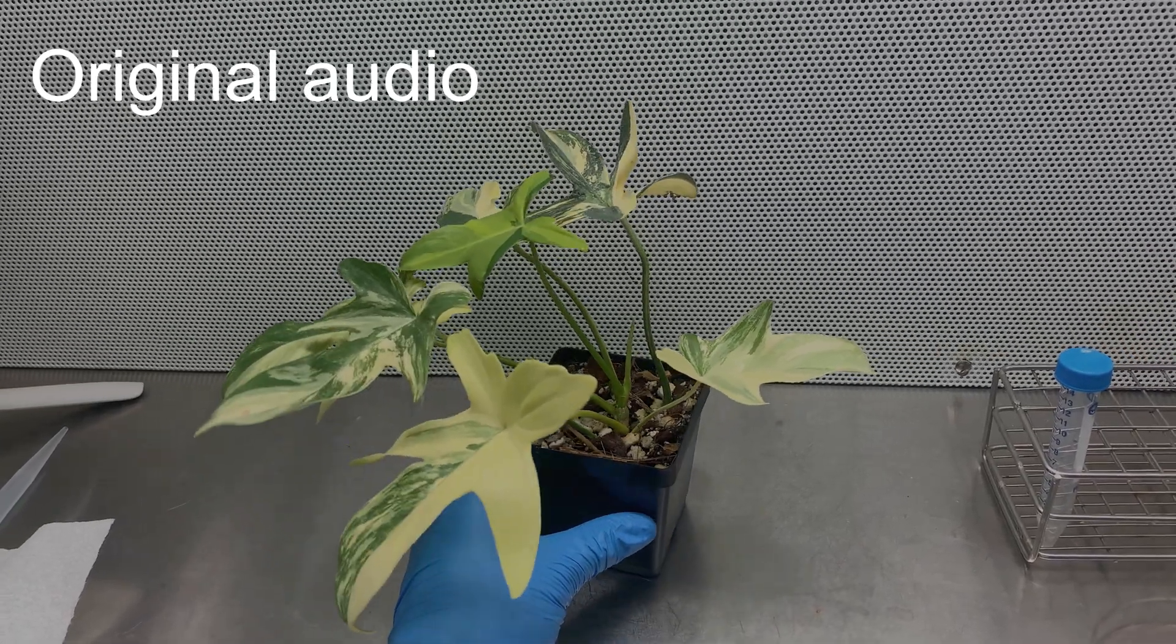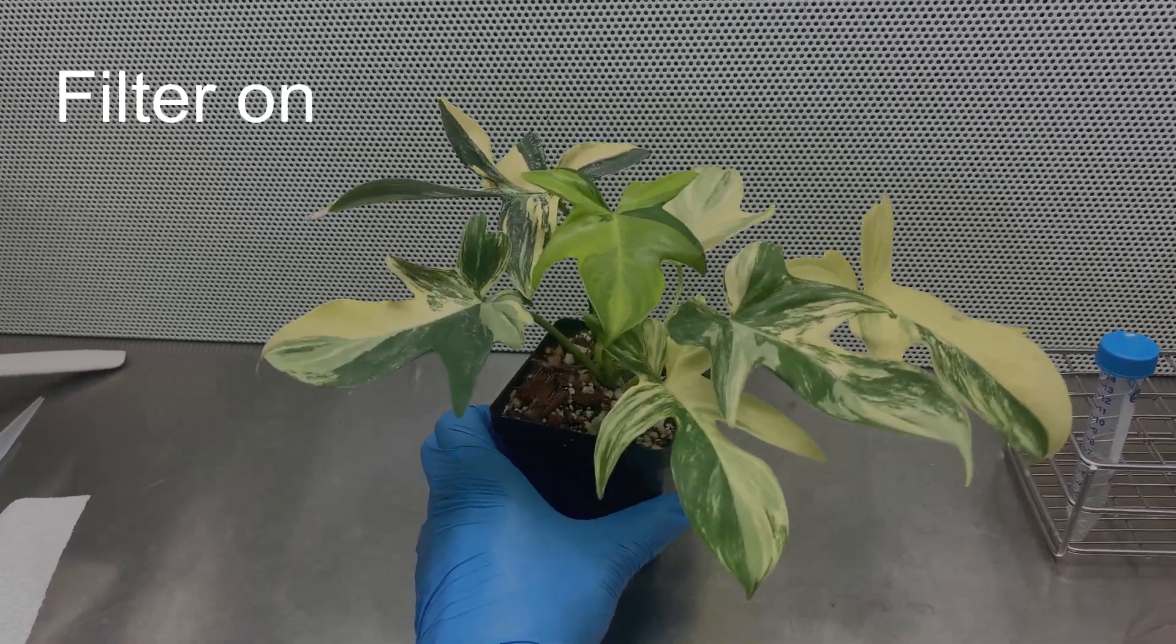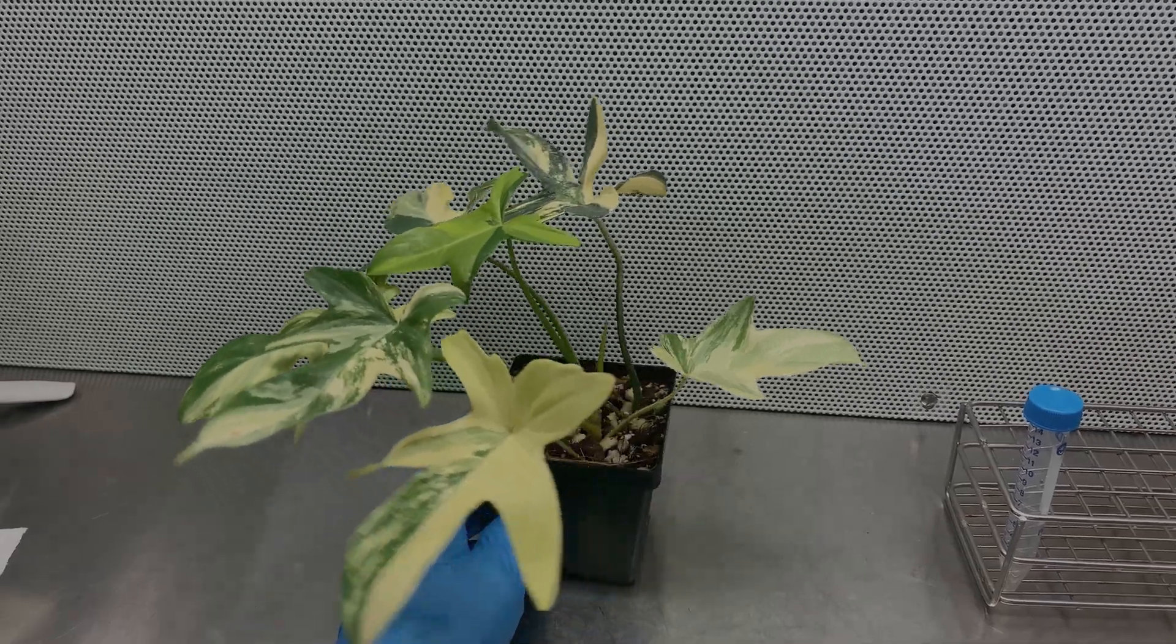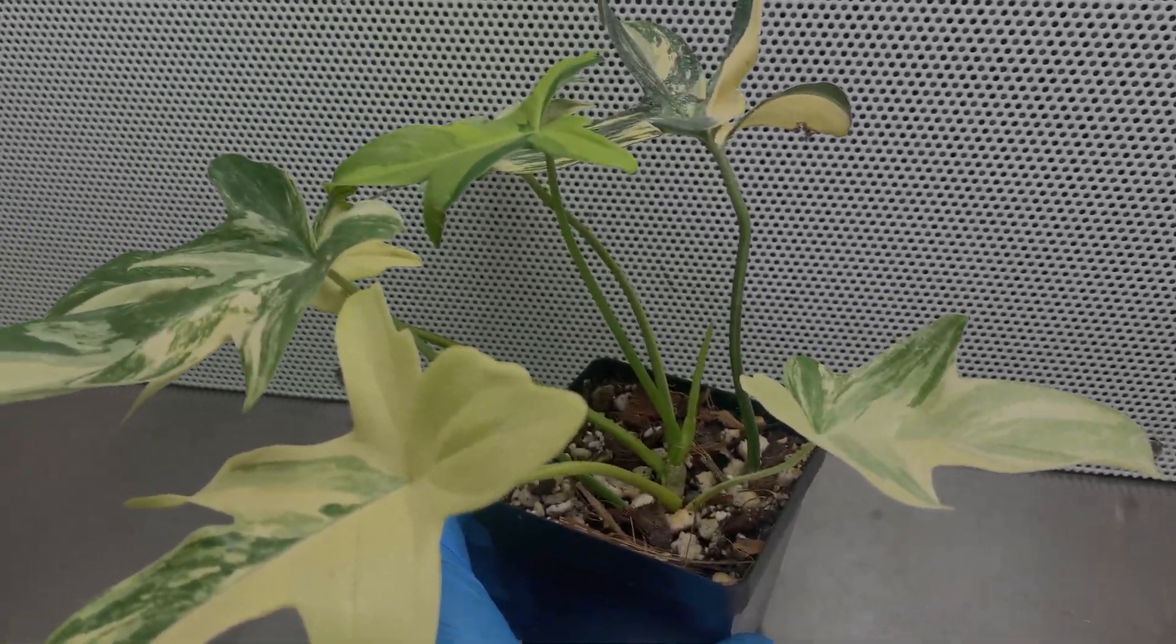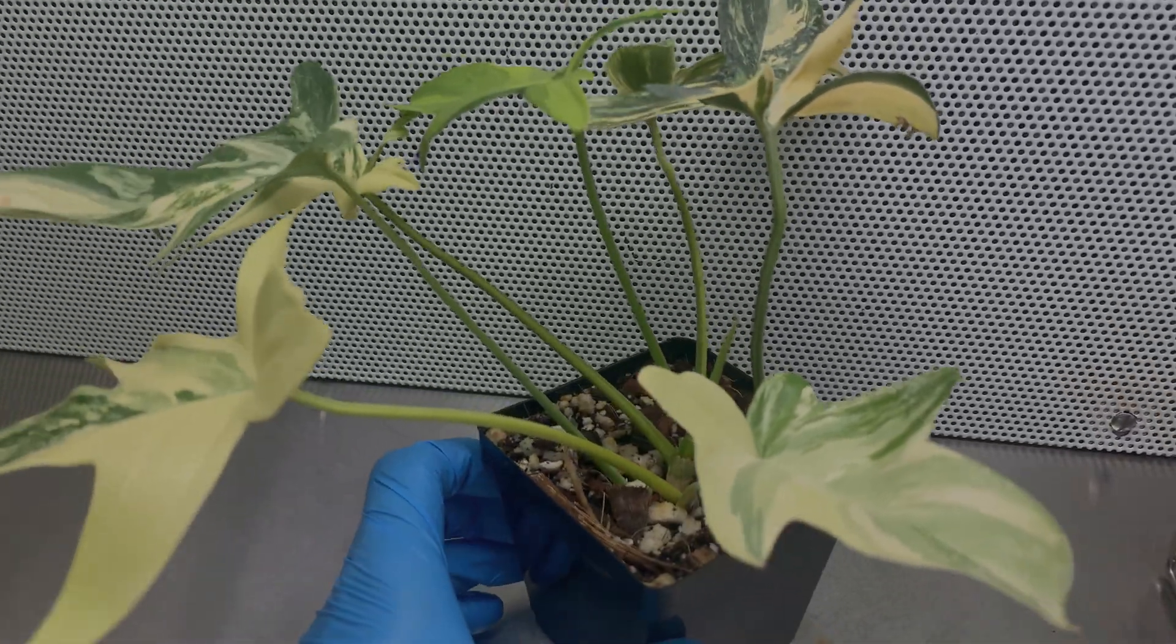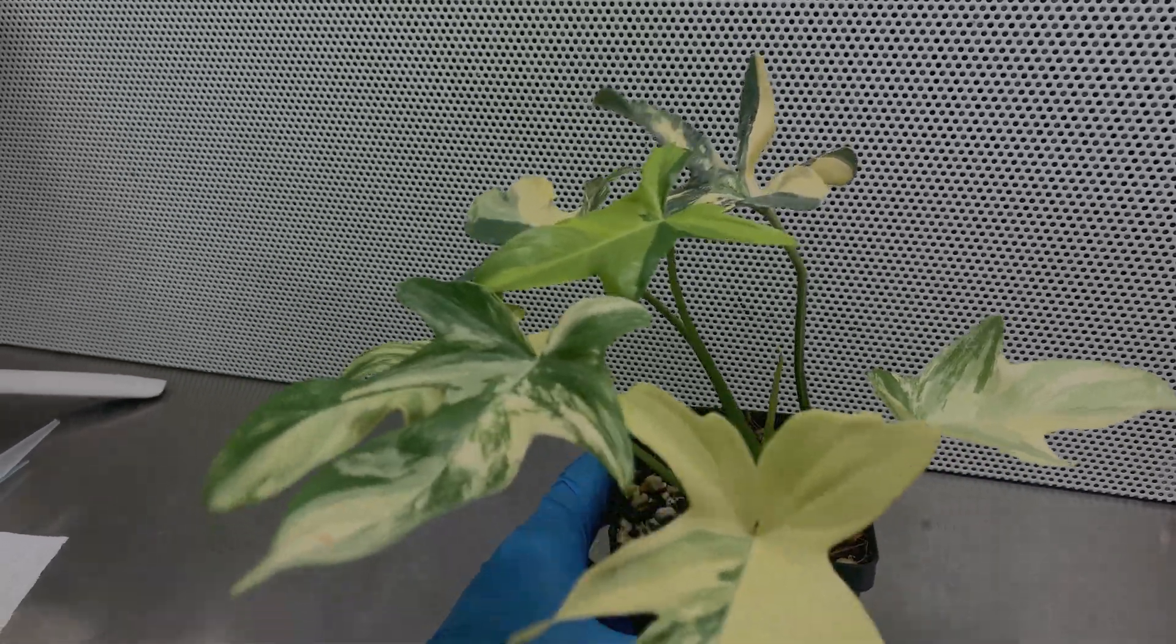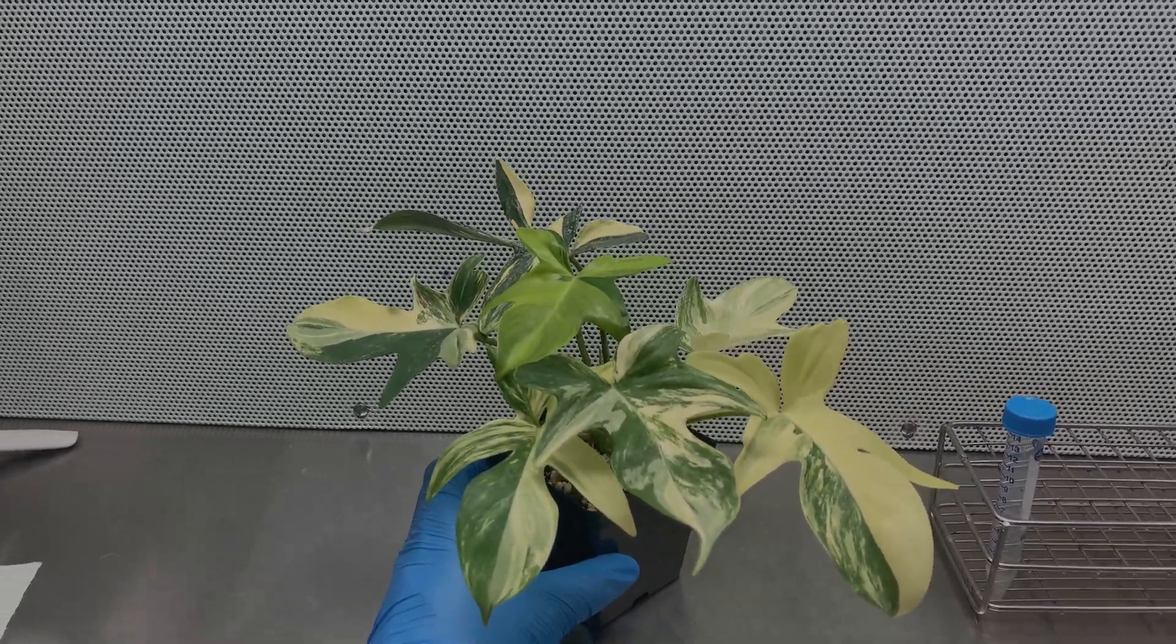To be honest I'm terrified to kill this plant, so I decided I want to tissue culture it. That way I can hopefully keep this plant alive because for me it's actually easier to keep plants alive in tissue culture than outside of tissue culture. Also, I can make some money back because it was quite an expensive plant.